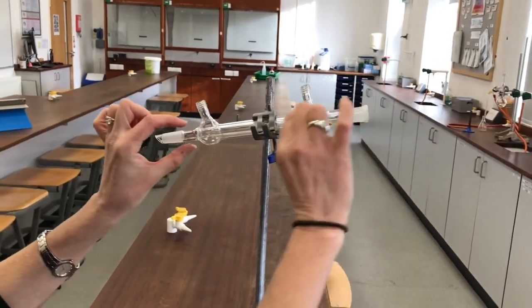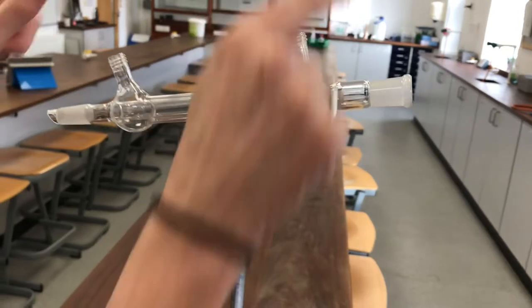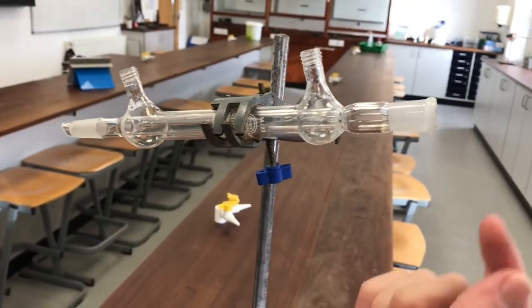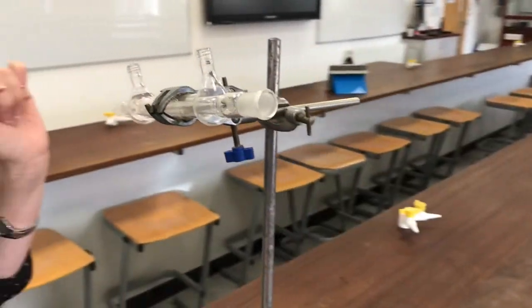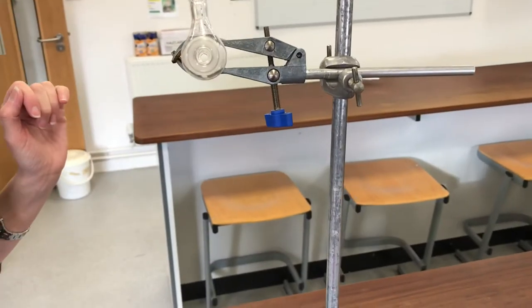It's actually made of a glass tube that goes right down the center of it with another glass tube around the outside. So I'm just going to get you to have a look right down the end so you can see there really is a tube there.